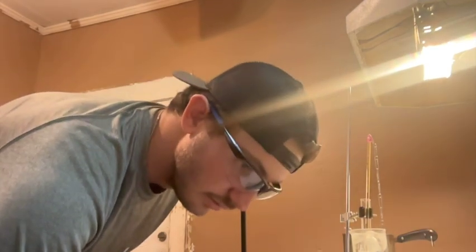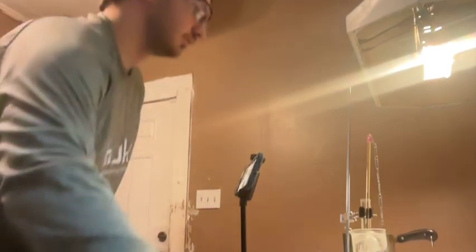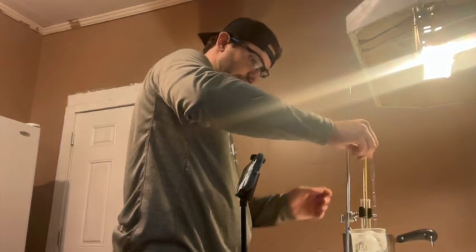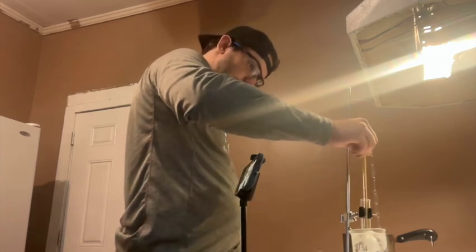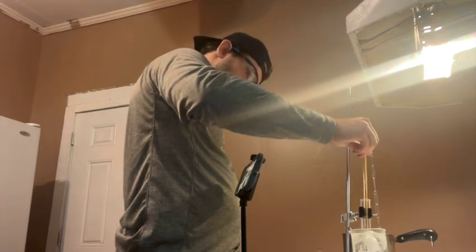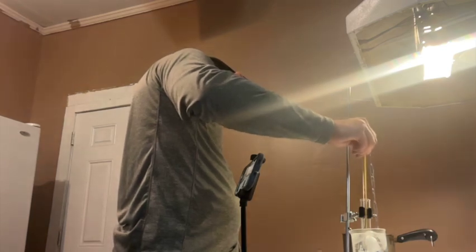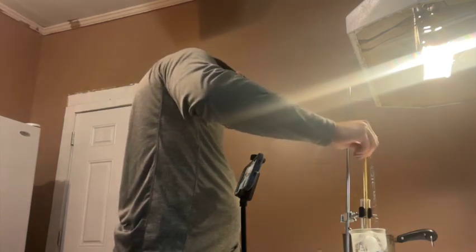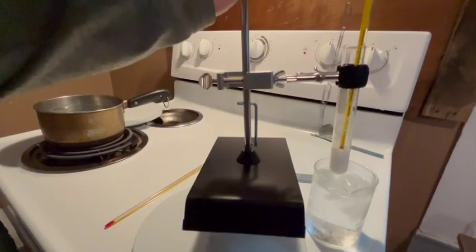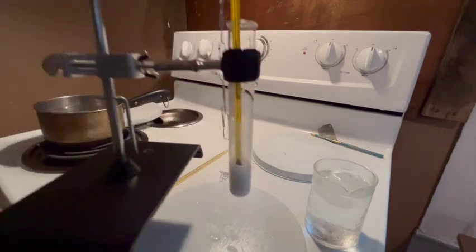After 4 minutes, we're at 32.1. And it's not completely frozen.